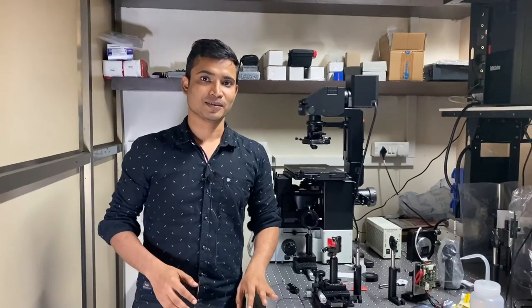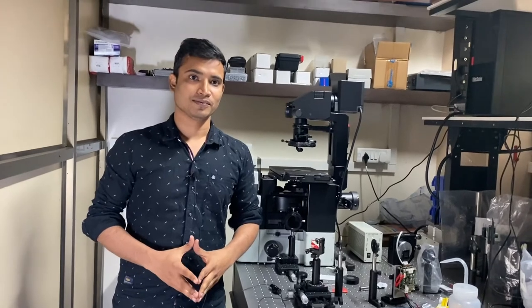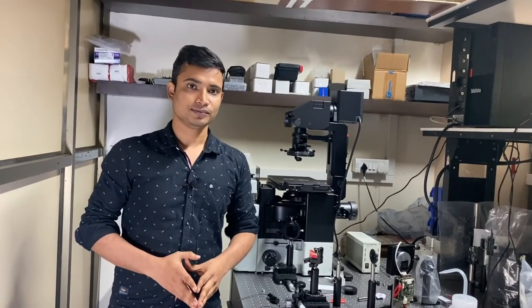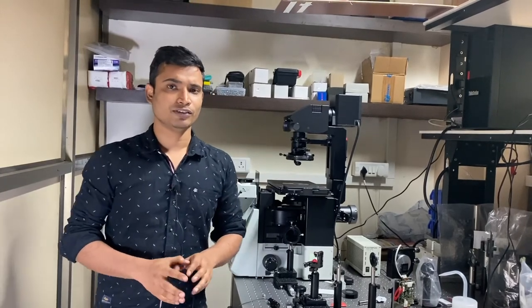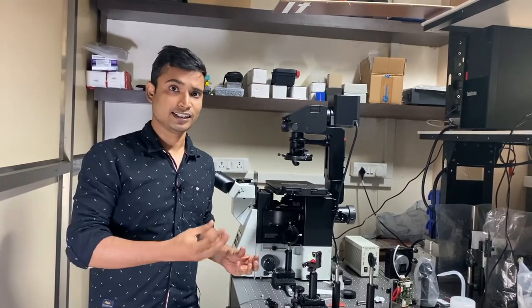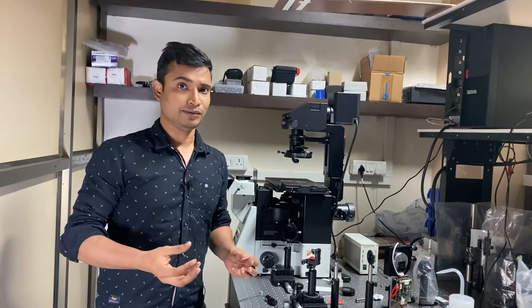How would you use this with biological samples? In biological samples, we can tag fluorescent molecules to different structures so that we can image them using fluorescent microscopy. With objective lenses of 40x, 60x, and 100x magnification, we can image in more detail inside the cell.